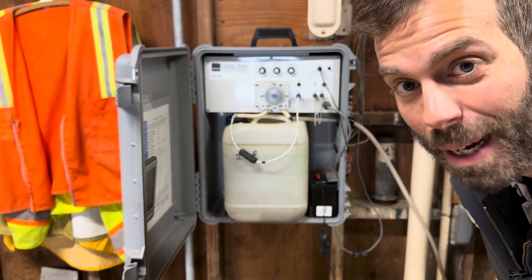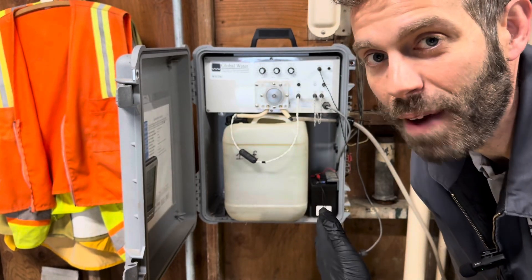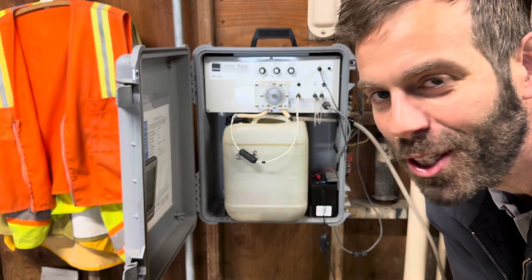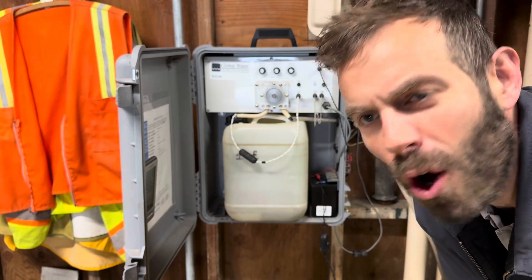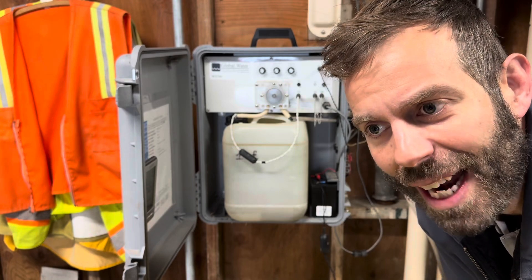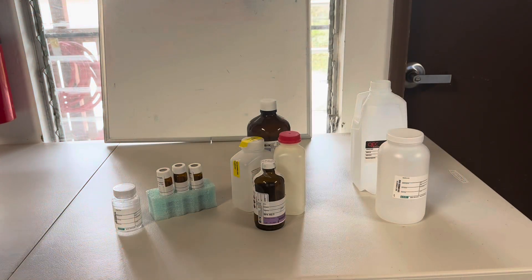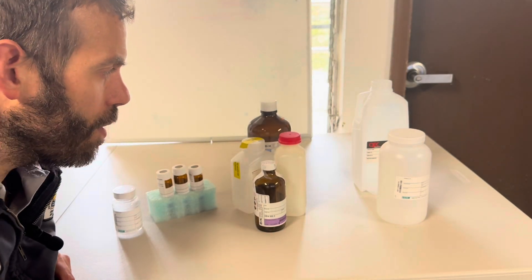There are a lot of different manufacturers and types of composite samplers — I don't want to deep dive into one specific model like the Global Water WS700. There are just too many varieties. What I do want to talk about is the different sample bottles you might run into. Let's go up to the control room and discuss the different kinds of sample bottles and their uses.